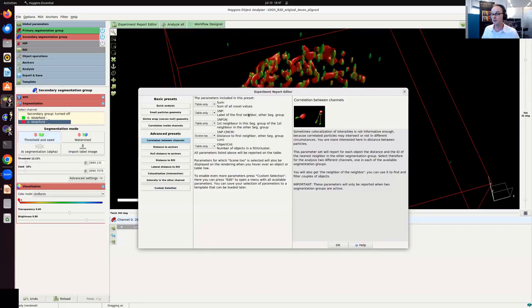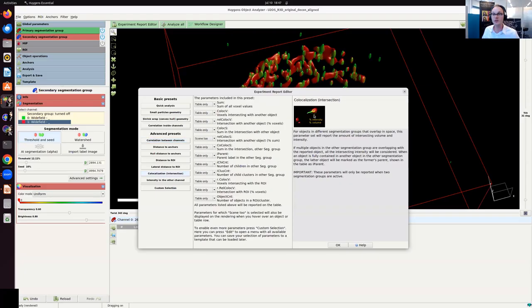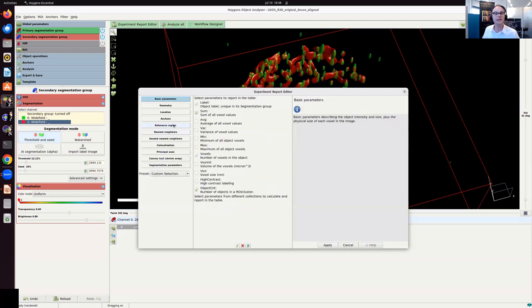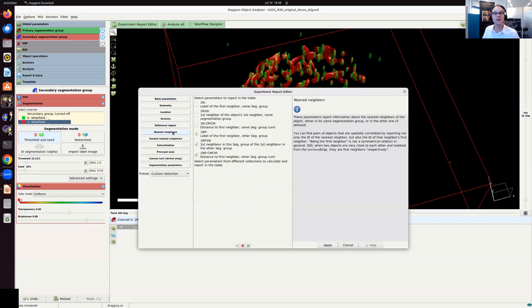For now, we want to measure the correlation between channels. So what's the distance? What's the nearest neighbor in the other channel? We also want to measure the intersection. So which part of the object is actually also covered by the other channel. So to enable both, I go here to custom selection, and then I go edit. And then I did this before, but I go here in the nearest neighbor tab, and I just enable these three options. These are the ones I need right now.